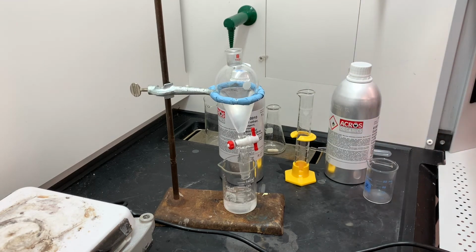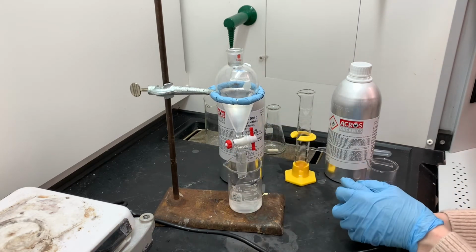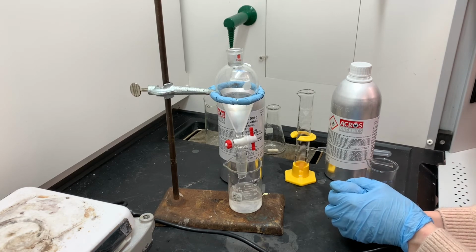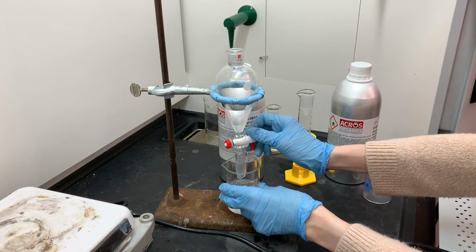And as I'm doing this draining process, I want to get all of the aqueous layer removed, plus also a little teeny tiny bit of the ether layer drained out as well. My goal is that when I remove the ether layer from the separatory funnel, it's going to be just pure ether and product. There won't be any traces of water or byproduct or anything like that.